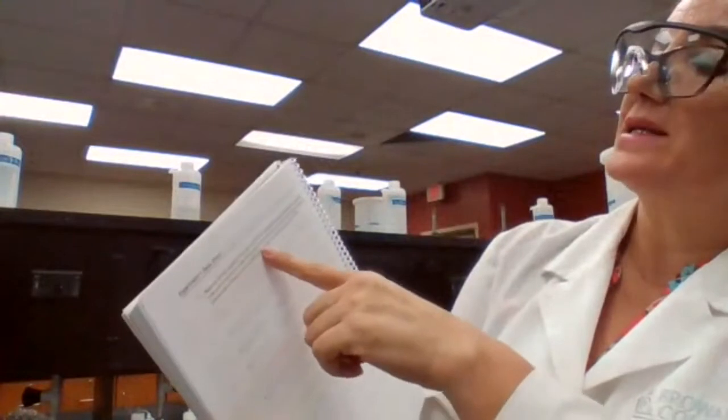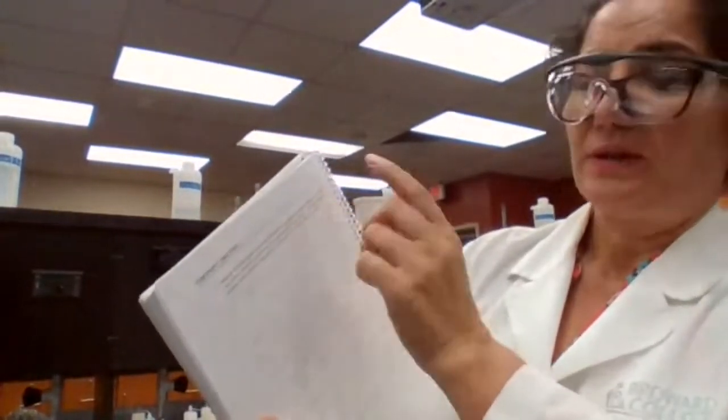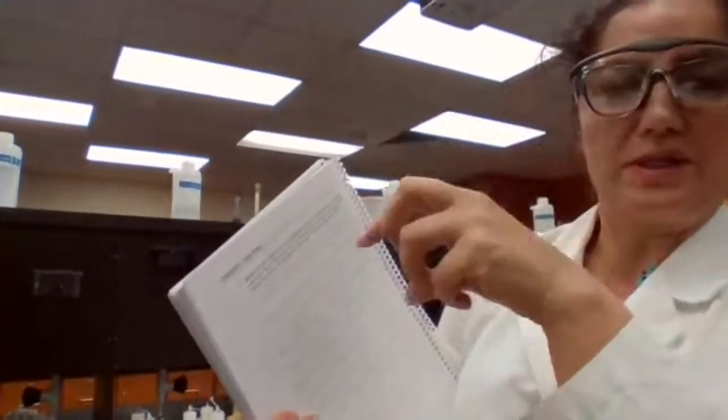You're not done with your experiment yet, because in this part, number 5 is asking you to write the chemical reaction. You just have to add the two reactants from test tube 1, compound A plus B, switch it, and make sure that the products have switched or exchanged partners.